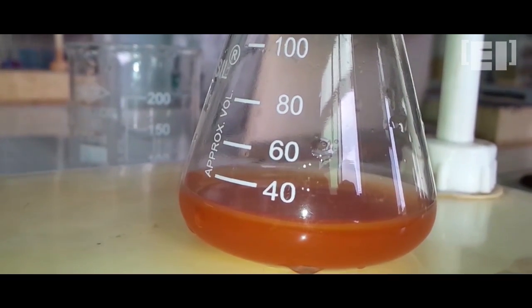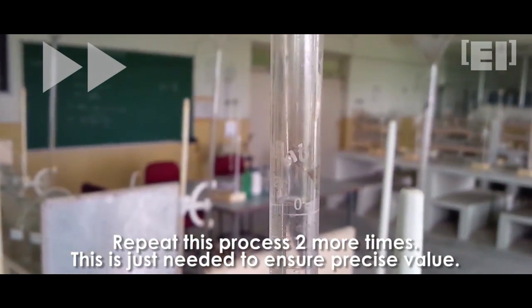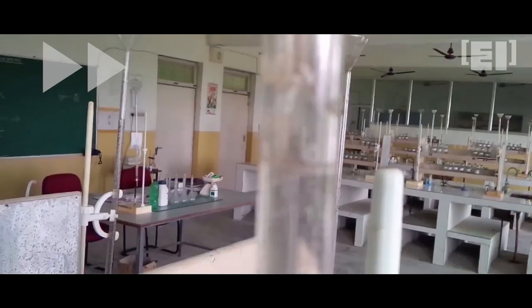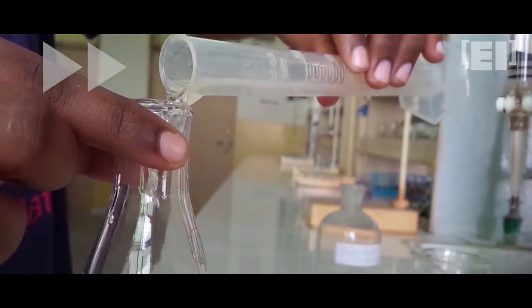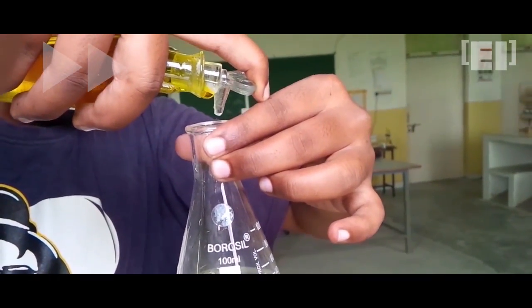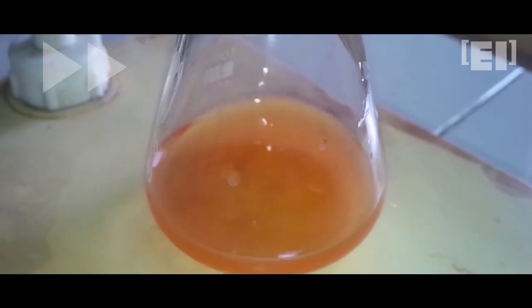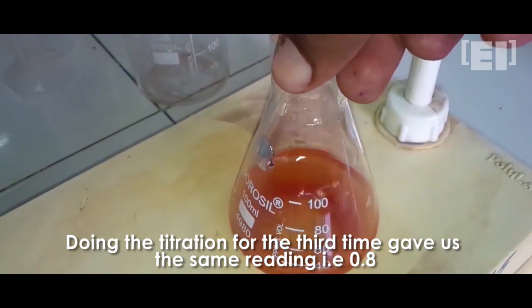This is the color we were looking for. Repeating this again. The reading is 0.8 ml. Doing this for the last time.